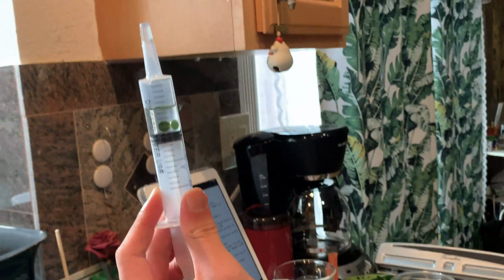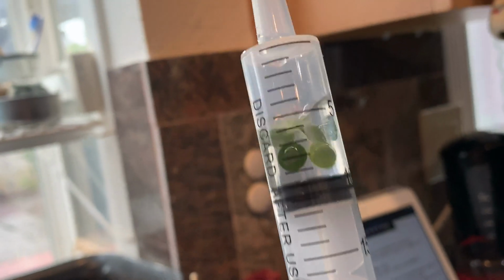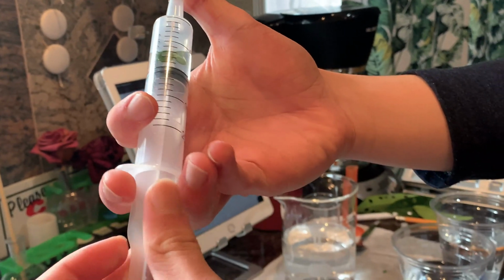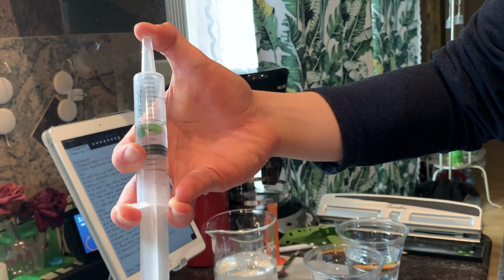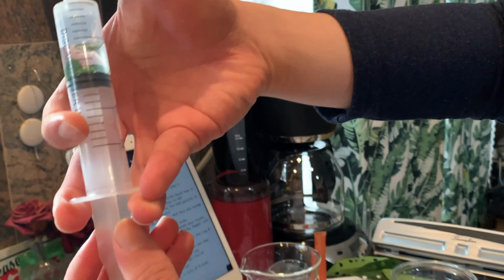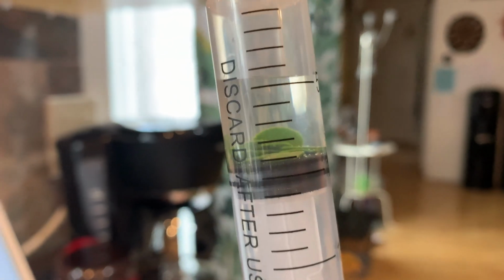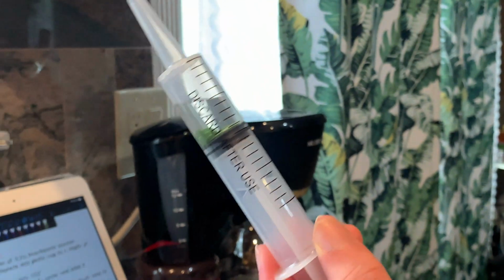So you can see the leaf discs, most of them are floating. And that means that there's still gases within their mesophyll. And then to draw the gases out, we will create the vacuum. So put my thumb on the tip and then draw the plunger back. Do it a couple of times until they all sink. As you can see, some of them are sinking. There's still 2 floating. Okay, so now the leaves have sunk. This means that the vacuum has drawn out the gases within the plant leaf.